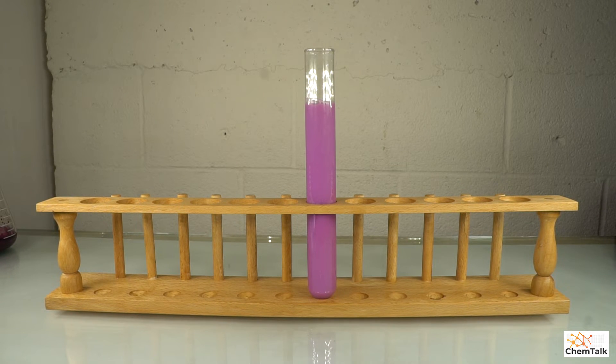I'm going to let this settle for a little bit and we'll see if we can see the two amazing colors that result. We'll come back in a little bit.